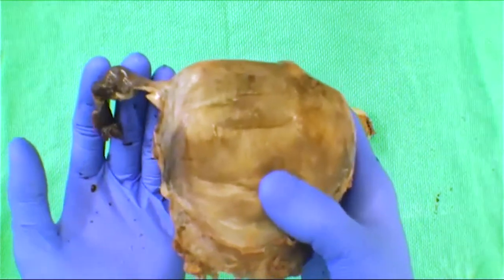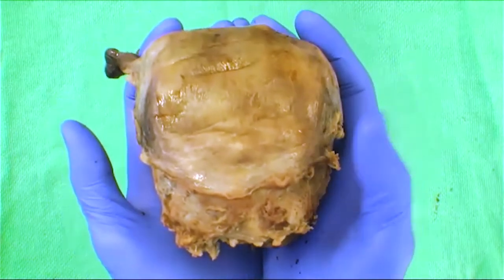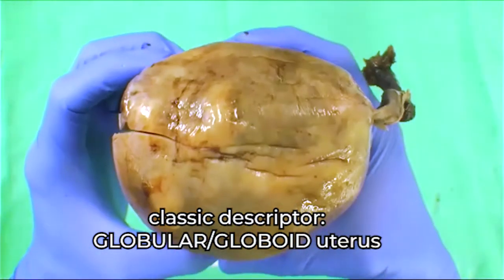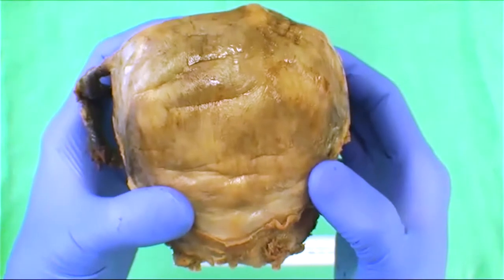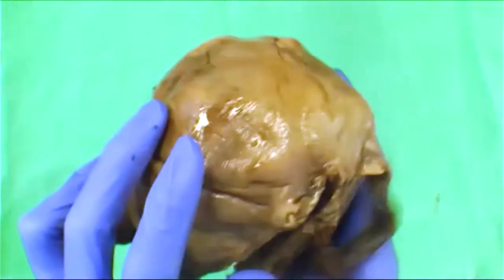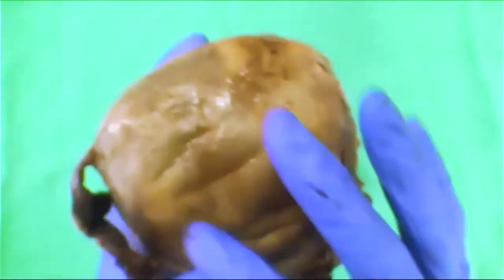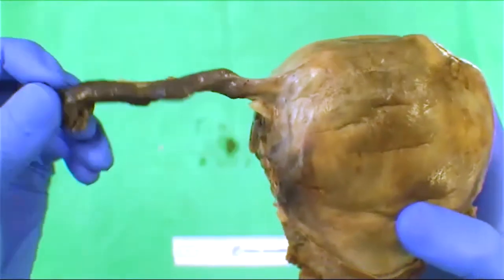This particular uterus weighed 456 grams — just a little over a pound — which is a pretty bulky size. It has a very bulging, globular appearance — round and spherical. Assessing the serosa, it has a very nice smooth appearance with no real nodularity. There are no subserosal masses as you might see in a fibroid uterus, quite uniform, no congestion, no adhesions.